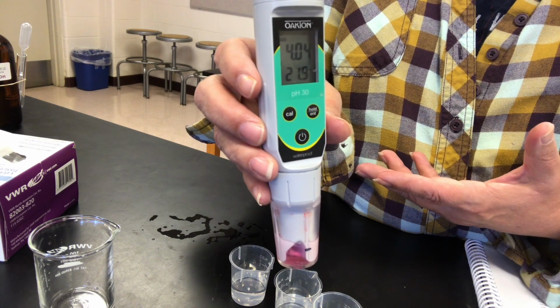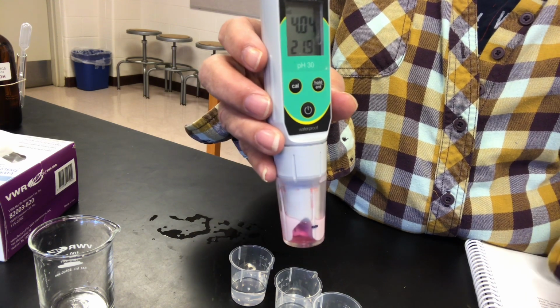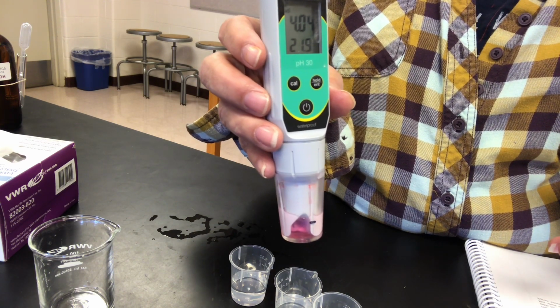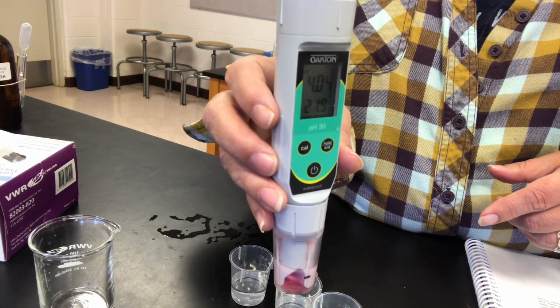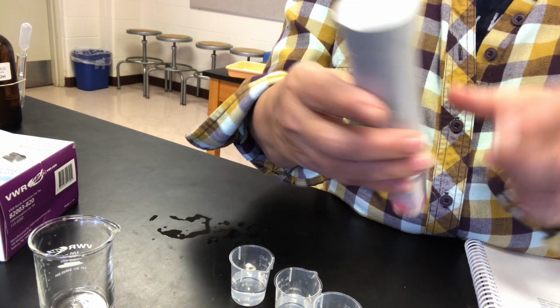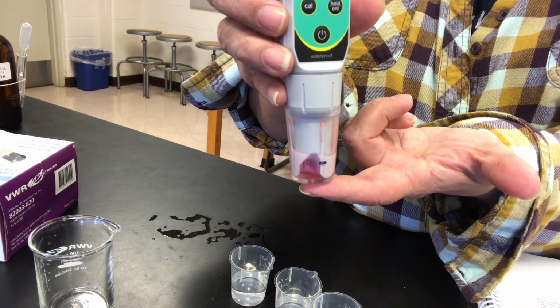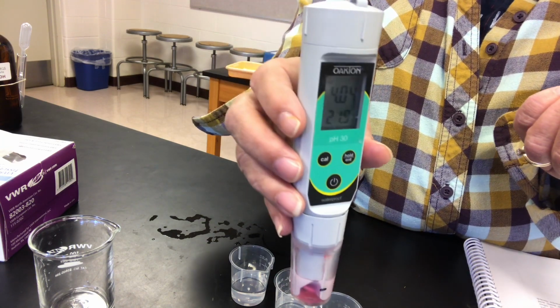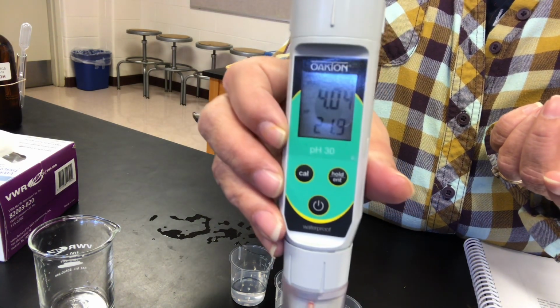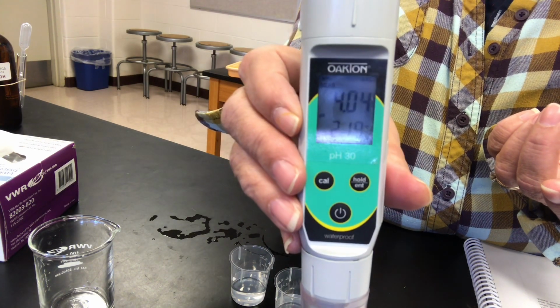and basicity levels. So we're only going to be testing the same solutions that we did last time that are not on those extreme ends. So the middle 5 solutions that we did are going to be retested looking at the pH with this pH meter. Down here is a buffer solution that you store the pH meter in because the bulb needs to be hydrated in order to work effectively. And you can see that that buffer is at a pH of about 4.